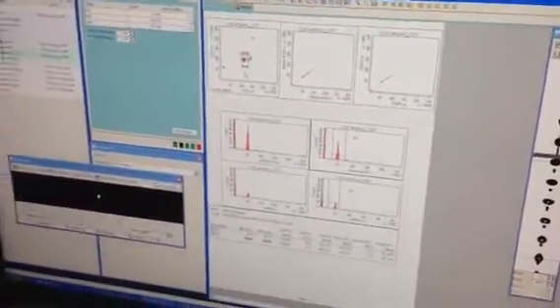And that is really all there is to setting up and adjusting the laser and optimizing the settings. These are the things that CST won't do, which is why I like to go through it. CST will tell you there's a problem, but won't fix it for you. And from here, we'll just save that data.